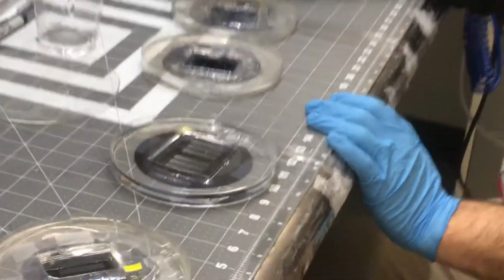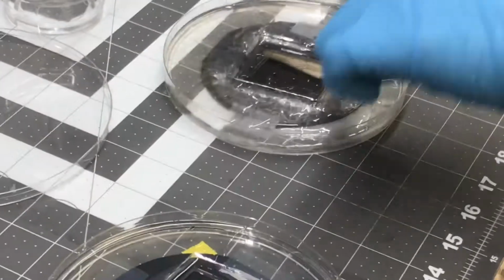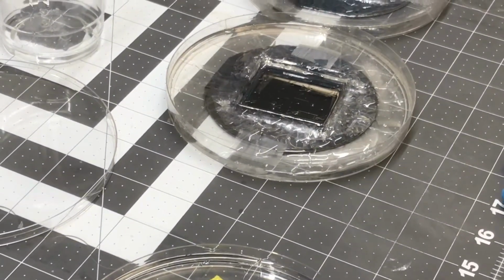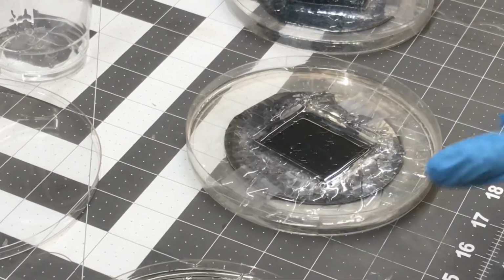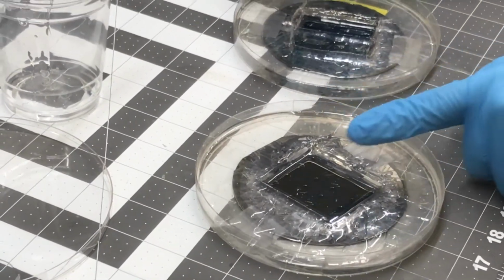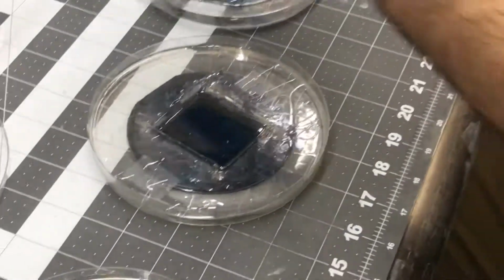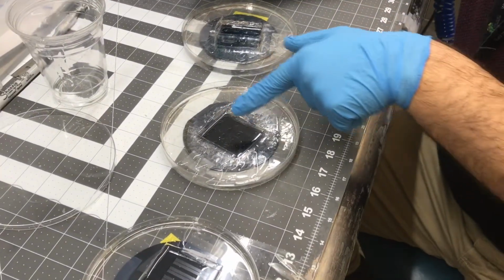You see this master mold. We put the PDMS on top of the master mold, and this is how you know the height of the PDMS. Totally exactly. And as you can see here, Dr. Hassan, can you zoom in, please? As you can see, during adding, some bubbles are created.